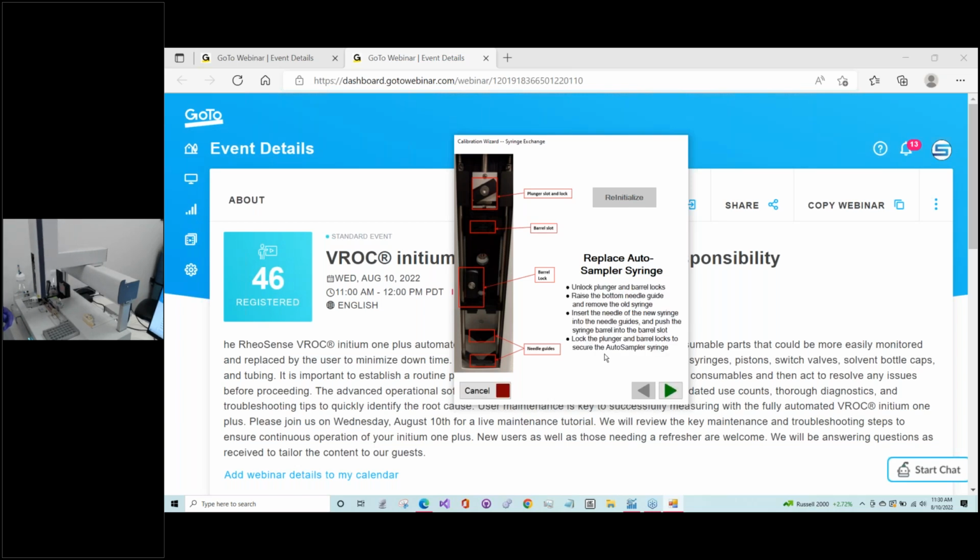All right. Try to move the camera a little bit so you guys can see what I'm doing here. All right. Okay. So in order to take the auto sampler syringe out, there are two things we have to move out of the way so we can loosen it. The first is this little lever right here. Just slide it to the side. And then the next one is this piece up here. So you want to make it parallel to the floor. And this part should just slide out.